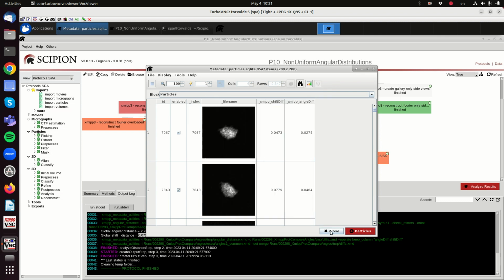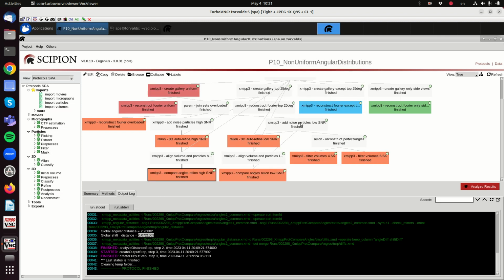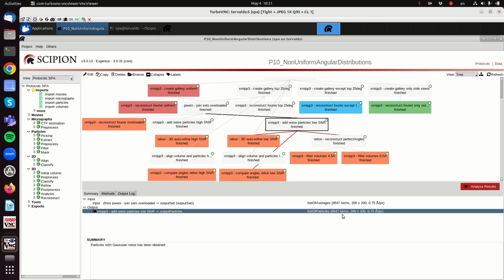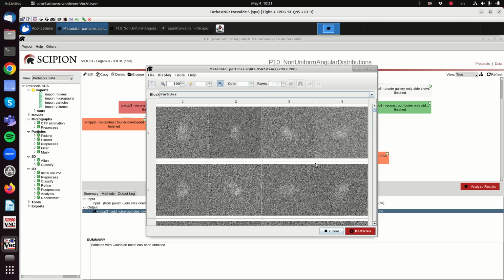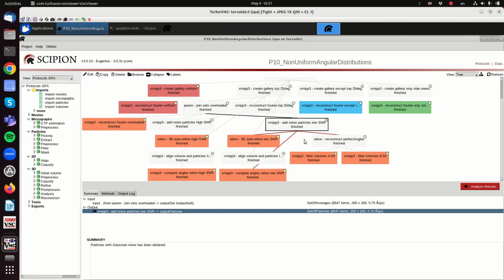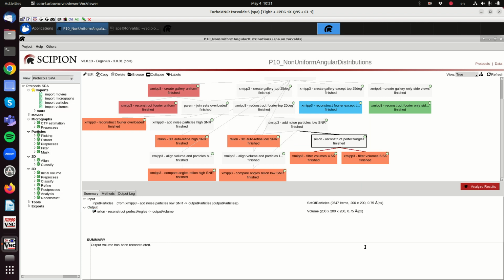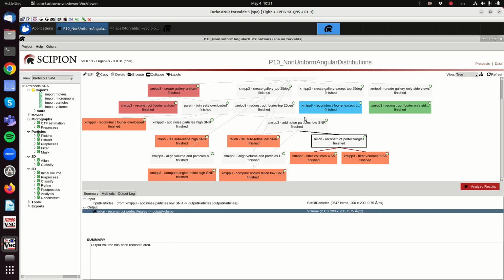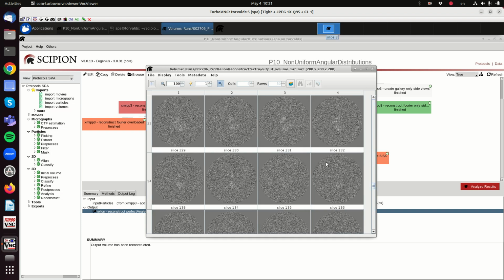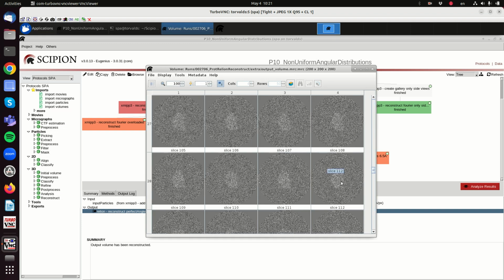Okay, so now let's put it in a more realistic setup. So now we will have a low signal to noise ratio, we have overloaded directions, and then the problem is if we use perfect angles. If we use perfect angles, with noise and overloaded direction, let's see if it causes problems. Well, there is a lot of noise, but this we already know.